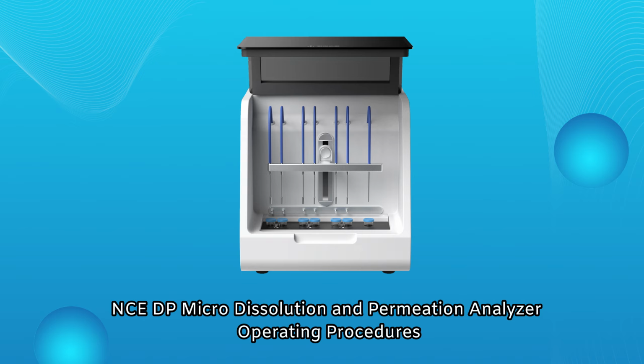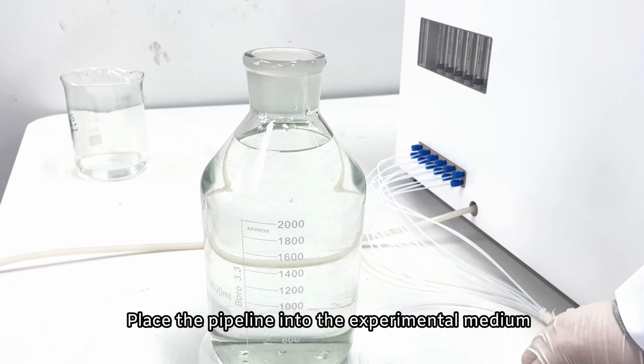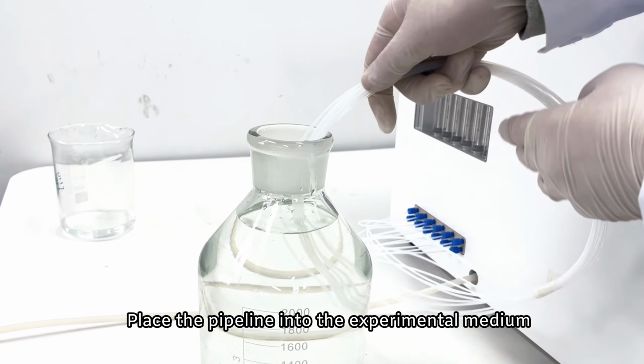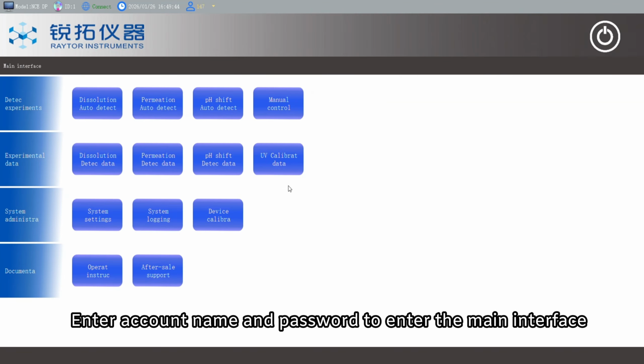NCE micro-dissolution and permeation analyzer operating procedures. Press and hold the power button to power on. Place the pipeline into the experimental medium. Enter account name and password to enter the main interface.